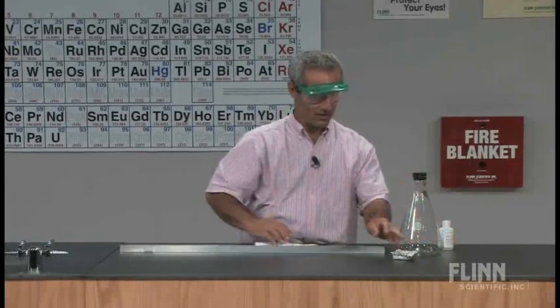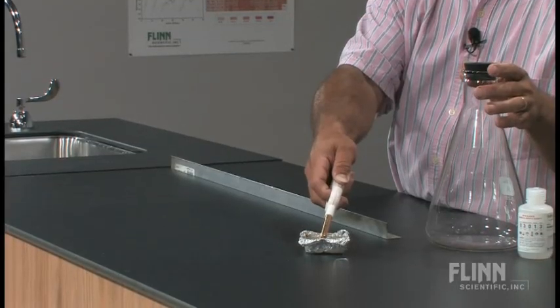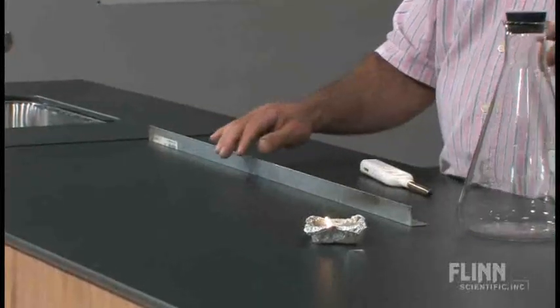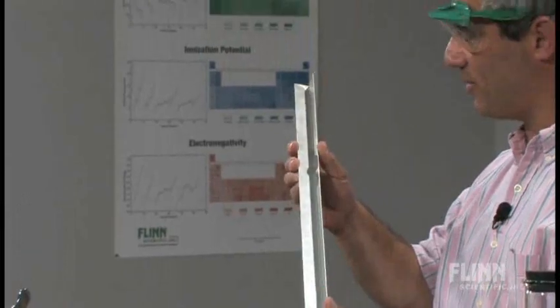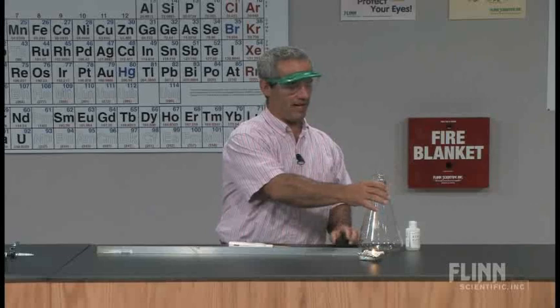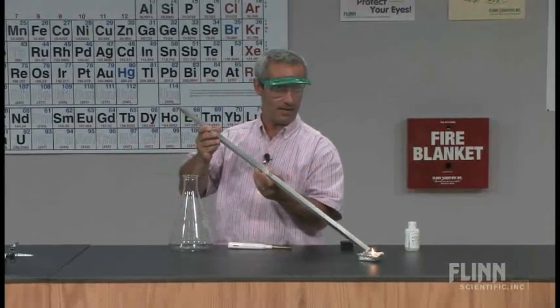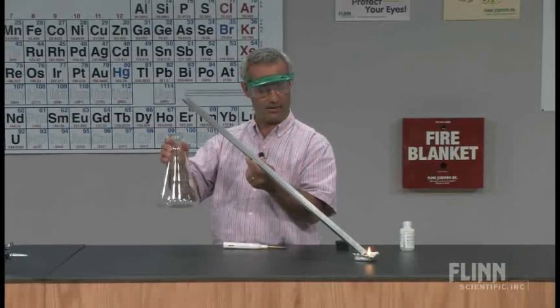Okay, so I've got a candle that I'm going to light here. And I put a little box there with aluminum foil around it just so it's a little bit more secure in this demonstration. And I've got a ramp made out of some aluminum angle bracket from the hardware store, easy enough to get. And I'm going to see if I can pour these vapors, just the vapors, not the liquid, down this ramp, and see if I can put out that flame. You may have seen this demonstration done with carbon dioxide. Let's see if this is able to do the same thing.